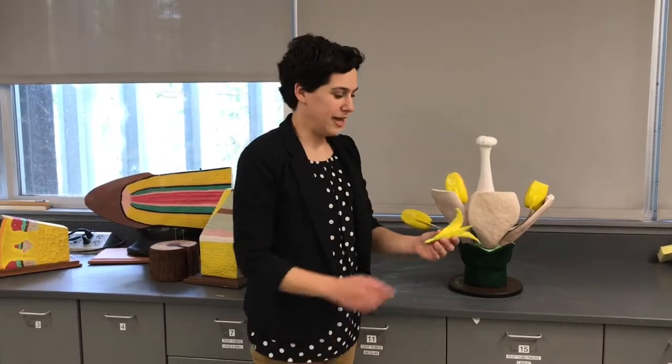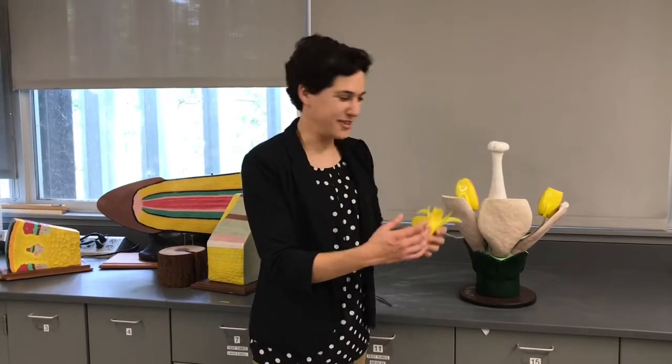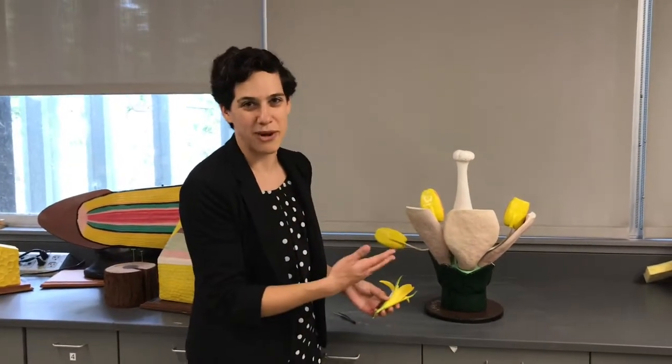To learn the parts of a flower, I'm going to be dissecting this lily for you, and I'm going to be showing you what parts they are on this flower model.